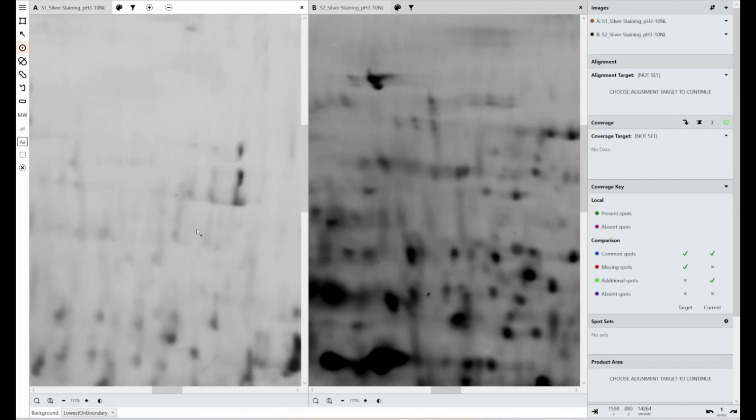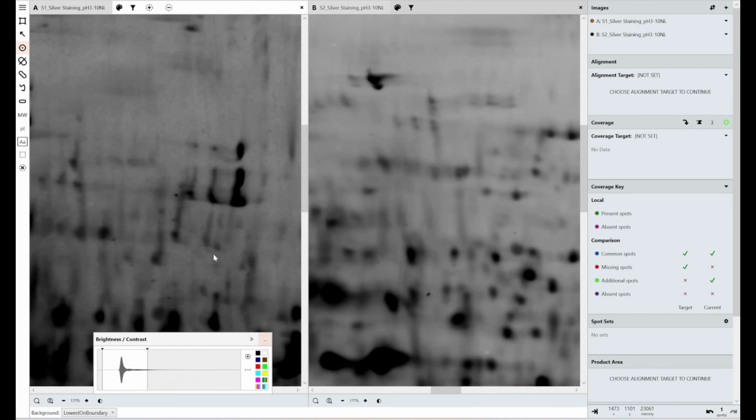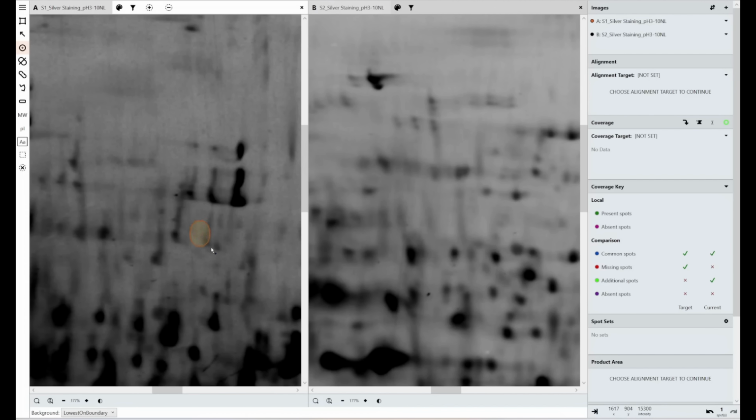Now, all of our image analysis software doesn't change the values that you get from the image because they're read from the raw TIFF file. All that changing contrast does is change how we as humans can visualize the data that's held within that image. So what I mean by that is, if you bring the contrast right down, you can massively increase the visibility of these faint spots. So you can draw a spot round here and get one of your faint spots.